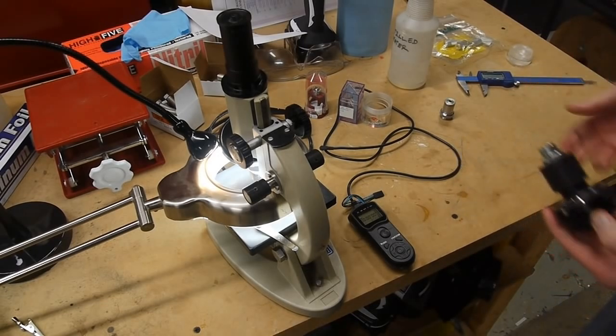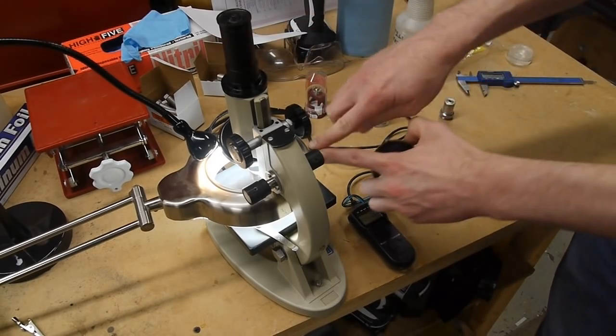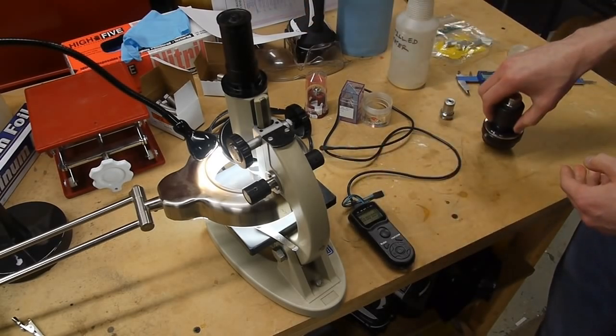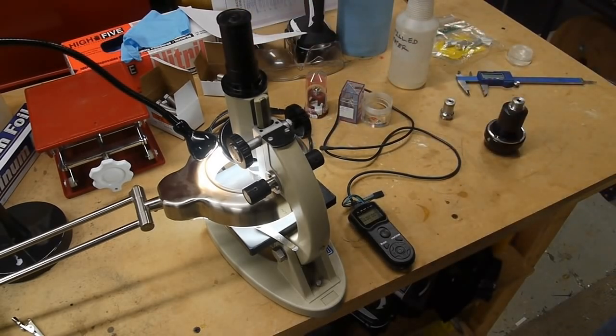So for most typical photography, I mean, if you're taking a picture of a mountain, the lens is much closer to the focal plane than it is to the mountain, so you actually have negative magnification there. In a microscope, it's the other way around, where the lens is very close to the object, but relatively far away from the image plane. So by moving the camera relative to where the microscope objective is, you can actually get different levels of magnification with the same objective.